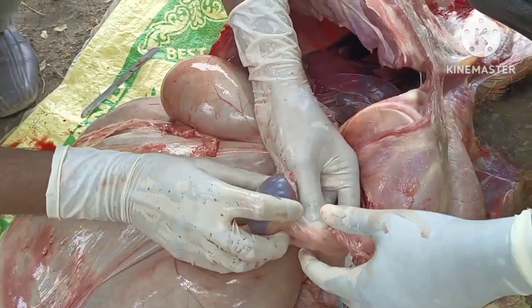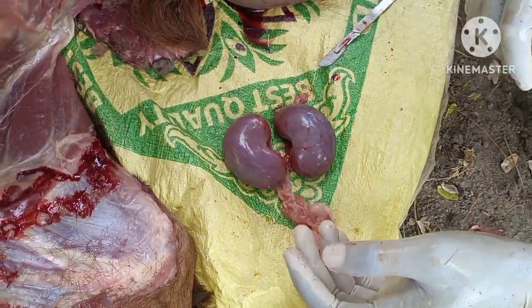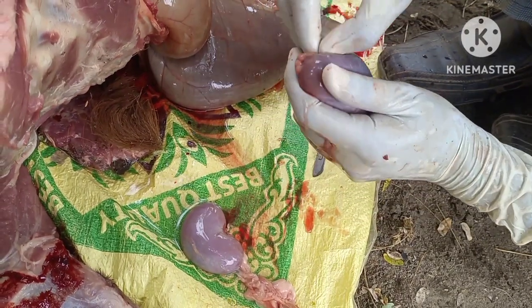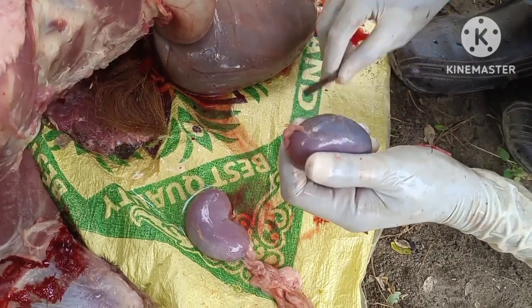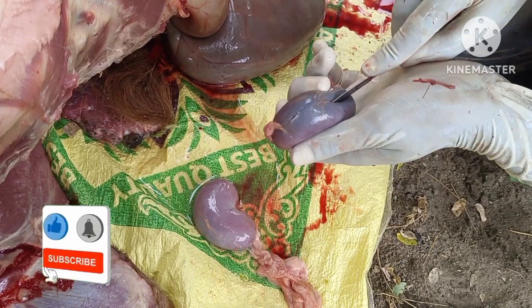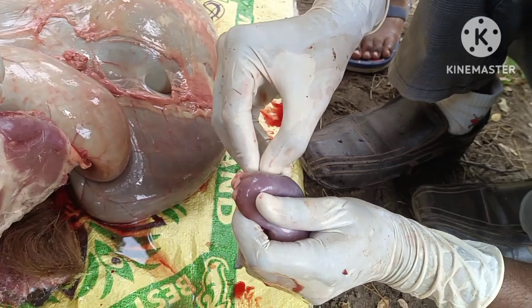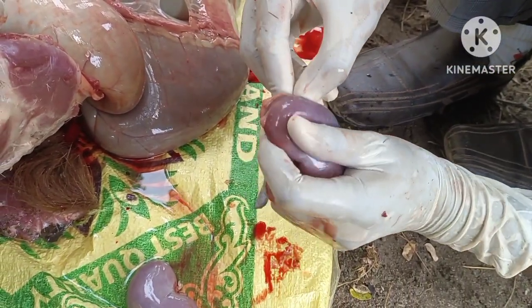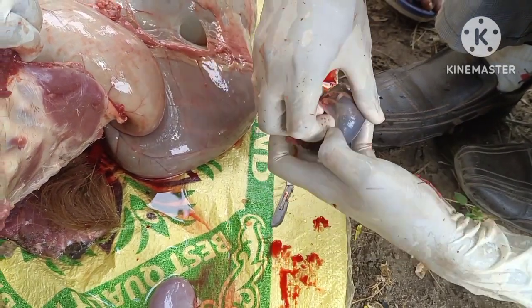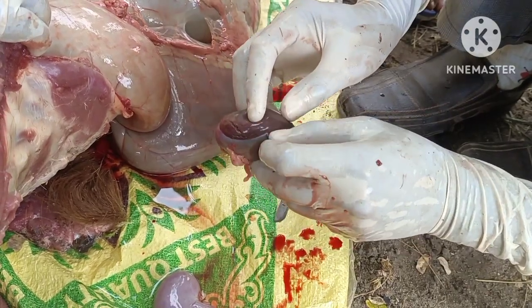And separate the kidneys. Take out the two kidneys and try to remove the renal capsule from the kidney by peeling it off by taking an incision. While peeling it off, if the capsule is coming freely, then it is okay. If it is not coming freely and if there are any adhesions of the capsule with the renal cortex, then it indicates chronic or acute nephritis conditions, which may be due to some poisoning or toxicity.